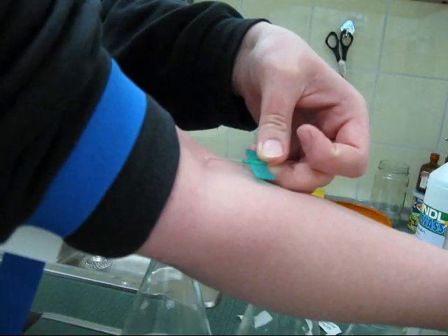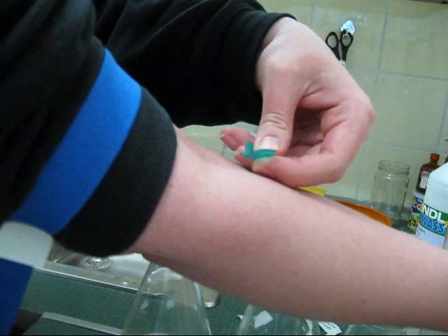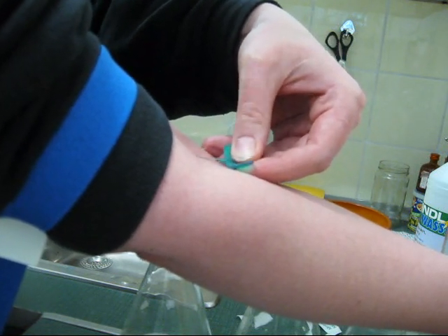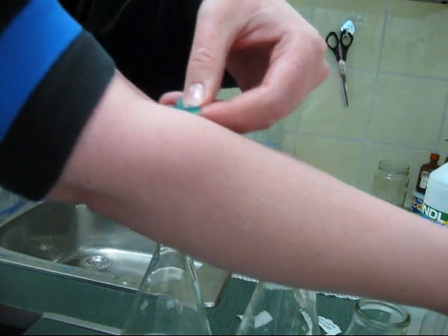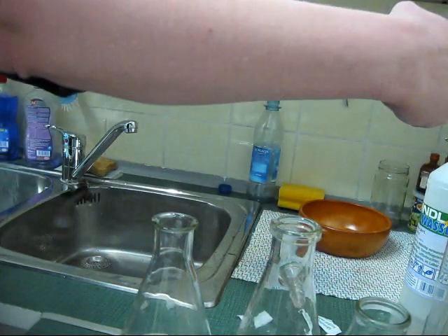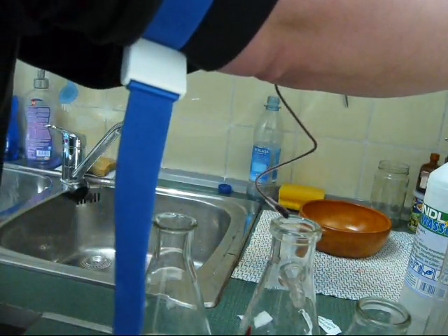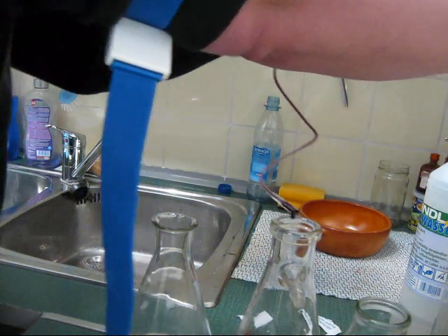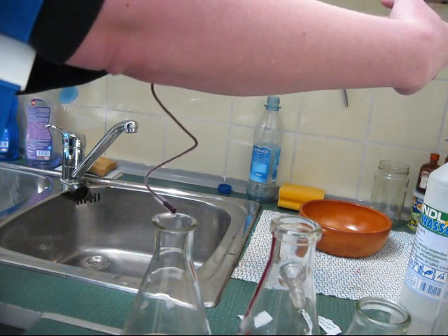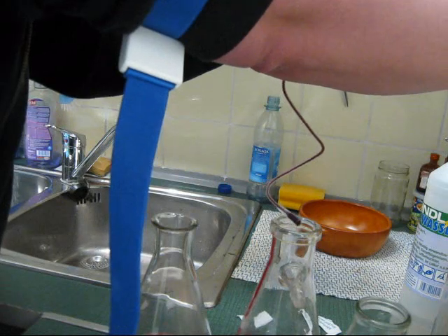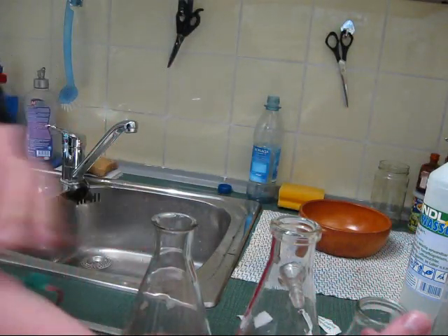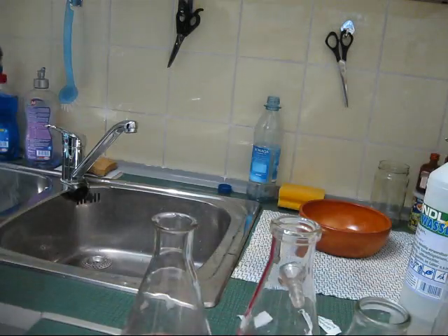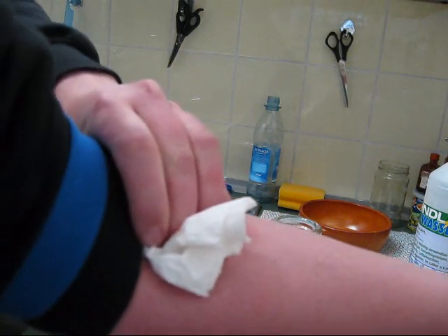That sucks. Okay, here we go. Blood in the thing. God damn it. Alright, that should probably do. Throw the needle and press, preferably with a swab, and let's see what happens next.